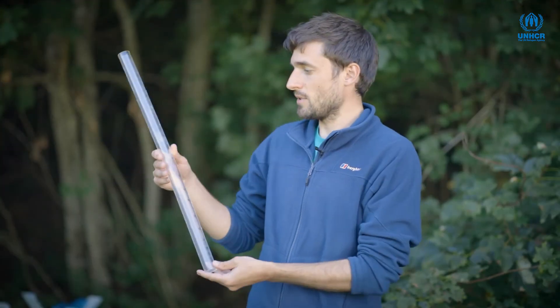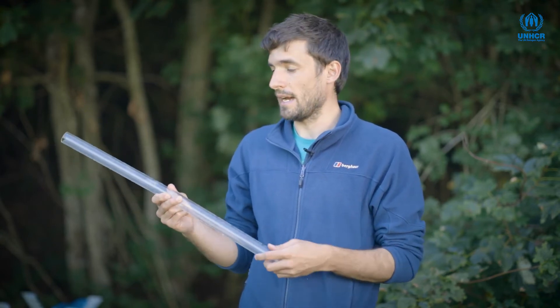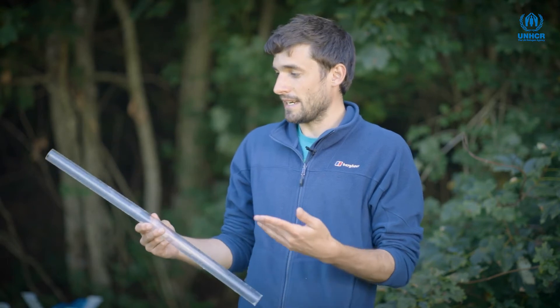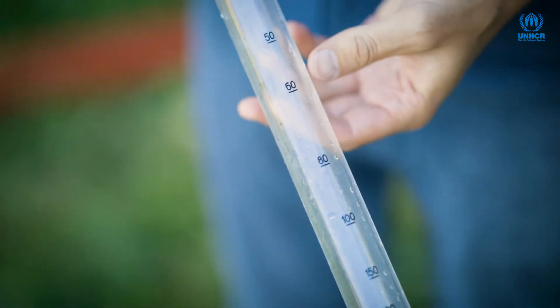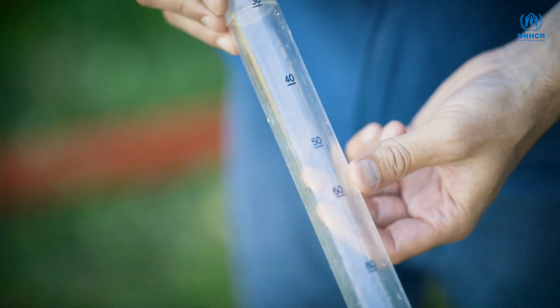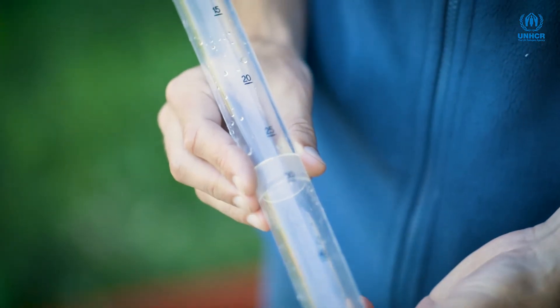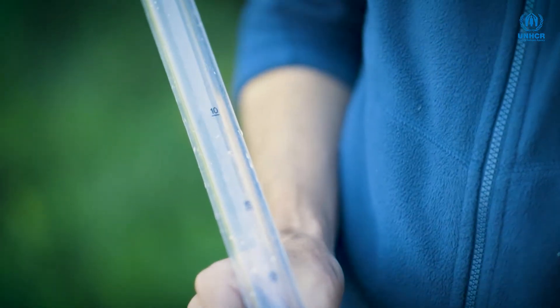We have this, which is called the turbidity tube — a really convenient field method for measuring how cloudy the water is. I particularly like this because it doesn't require any batteries, calibration, or anything like that. It's simply a tube with numbers on the sides.